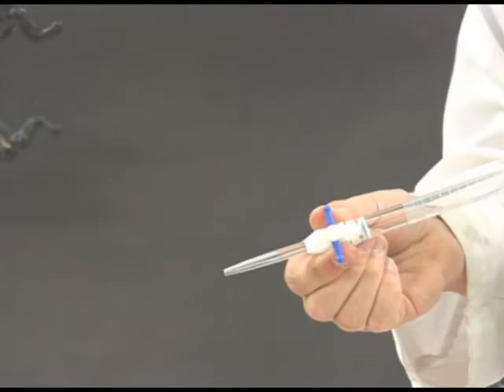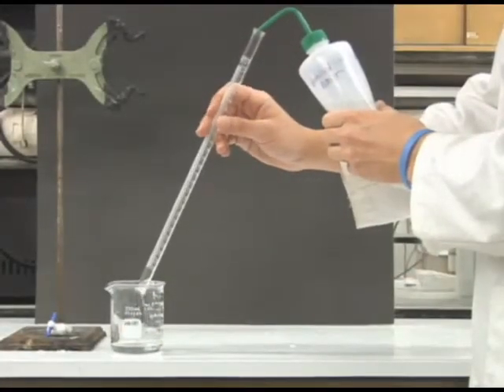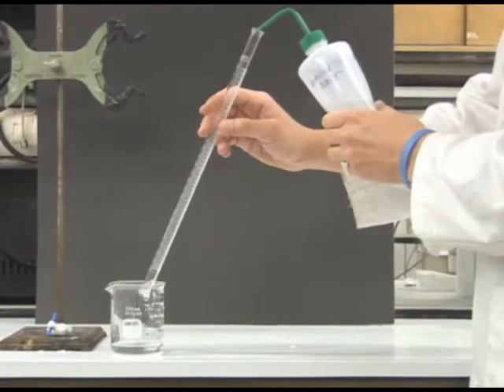To clean the burett, remove the tip and rinse it with distilled water while rotating the burett to make sure the entire inside surface is cleaned.